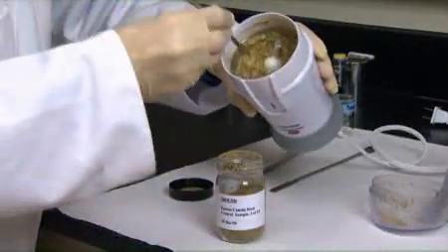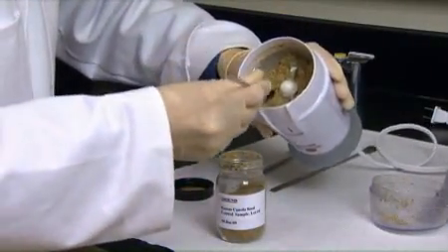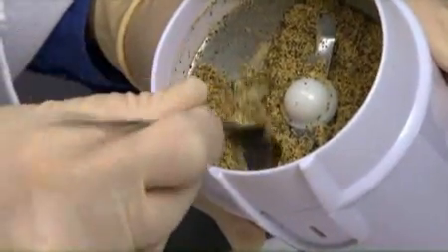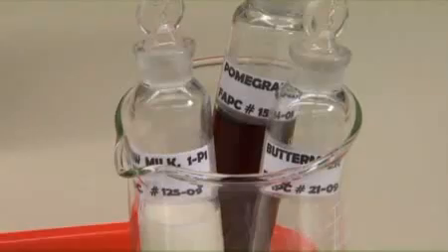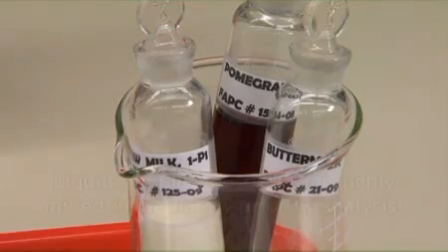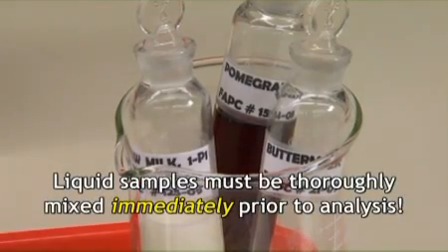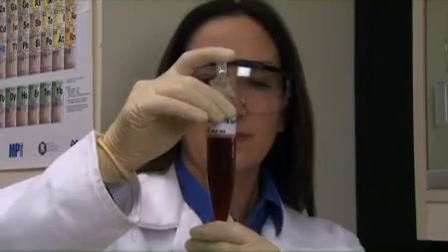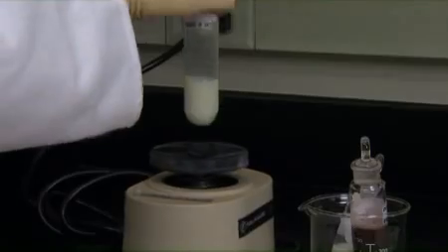After preparation, store samples in the most air-free packaging available and minimize exposure to open air. When preparing liquid samples, they must be thoroughly mixed immediately prior to analysis. In a tightly closed container, shake the sample vigorously. Alternatively, the sample may be placed on a vortexer.